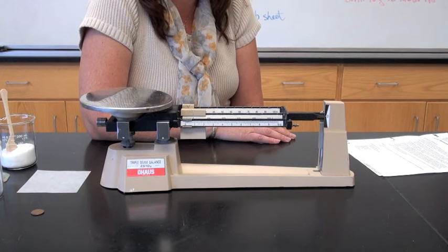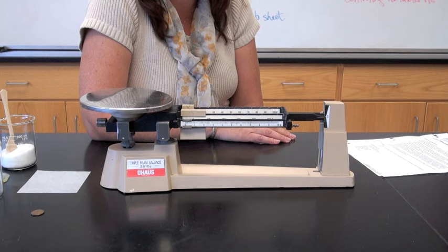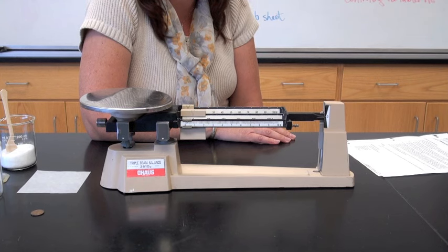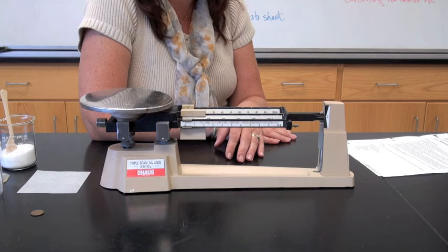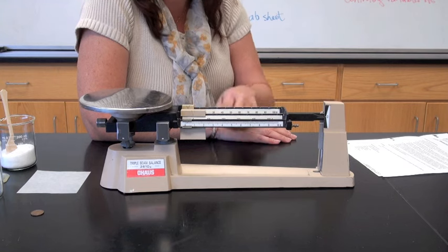Welcome sixth graders to the introduction of how to use a triple beam balance for measuring mass. This is a triple beam balance and it is comprised of several different parts.